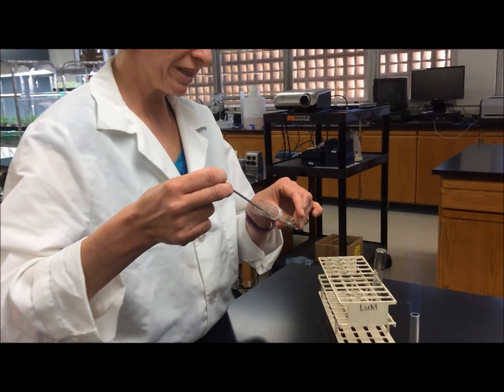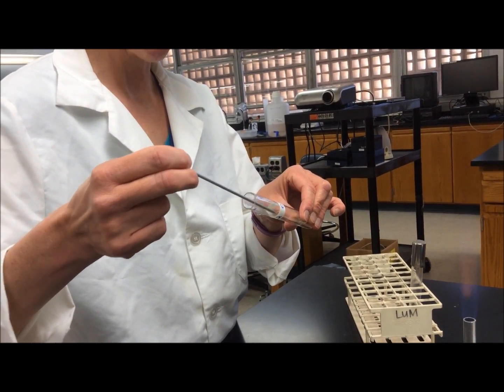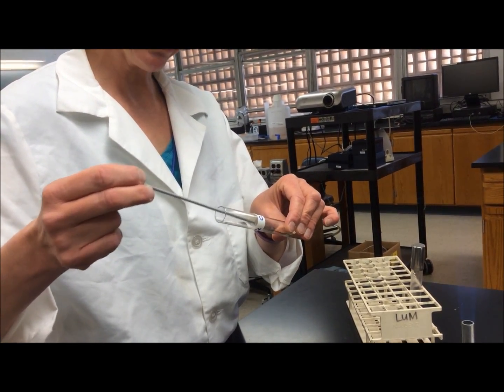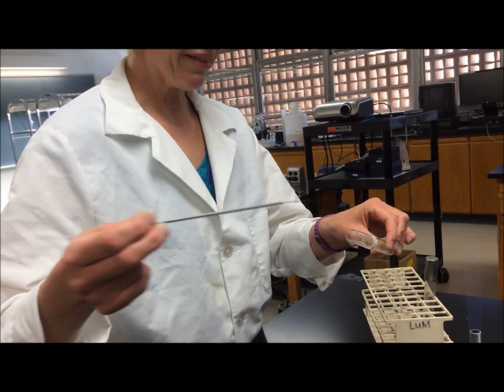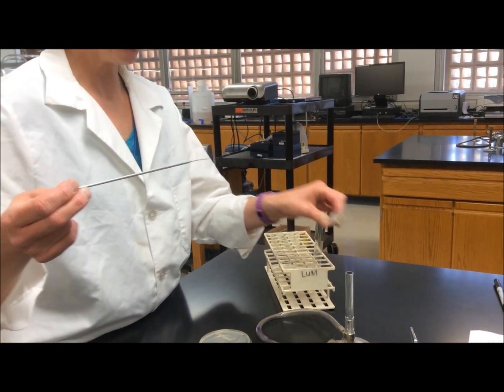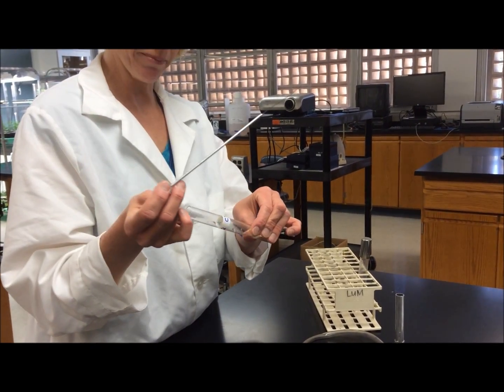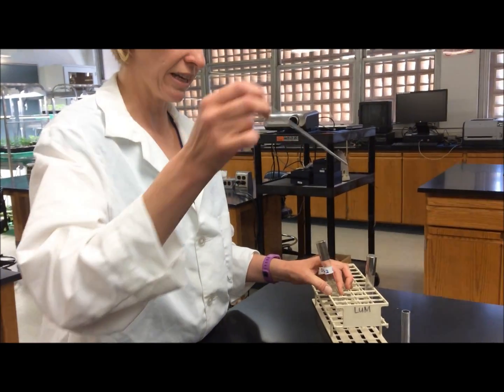Remember, this loop contains a small sample of bacteria from a single, well-isolated colony. You then just wiggle the wire around in the liquid media. When you remove the wire, you once again pass the neck of the tube through the flame, recap the tube with the cap in your right hand, and then you can set it down.